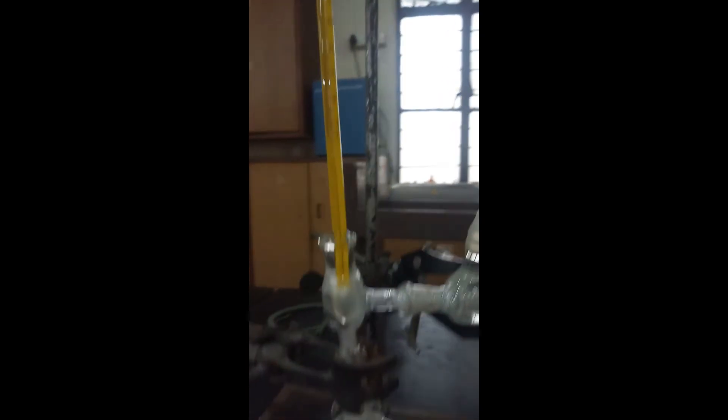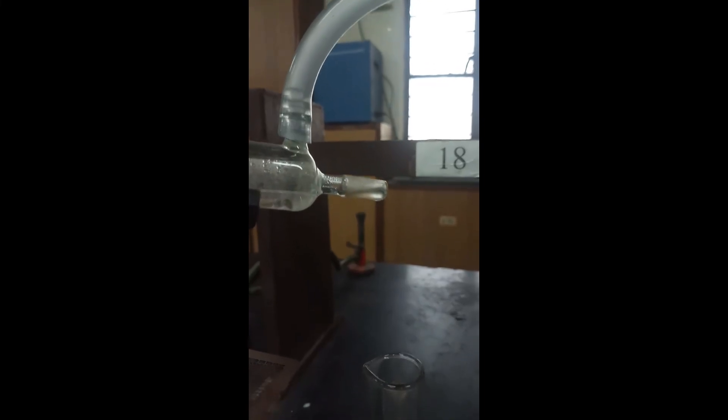And it will get collected in another receiving flask. Here we have used a measuring cylinder to collect the second component of the mixture. So one can see the condensation is taking place.